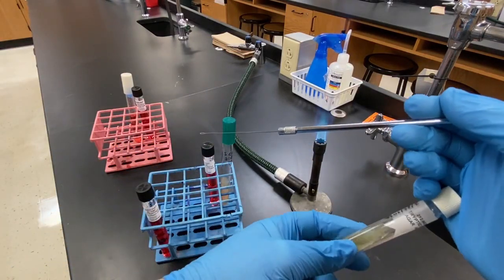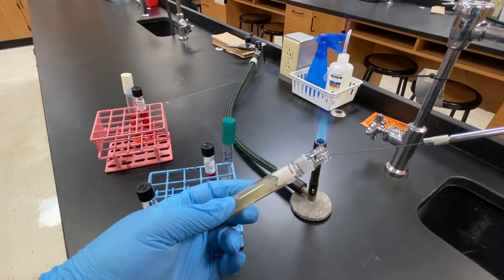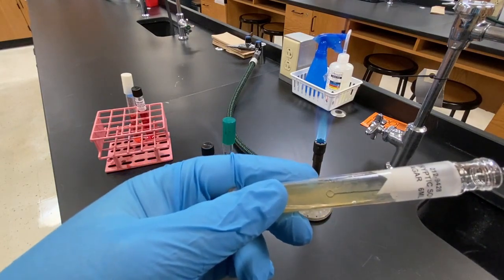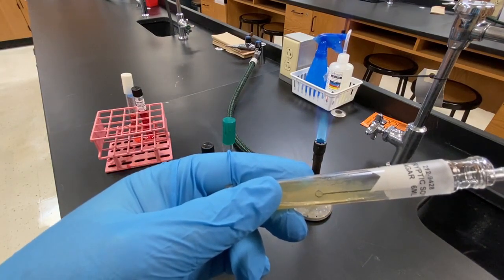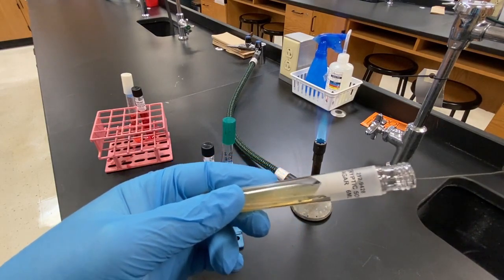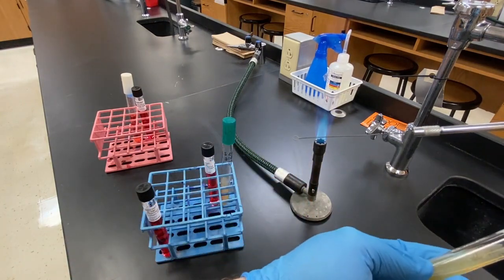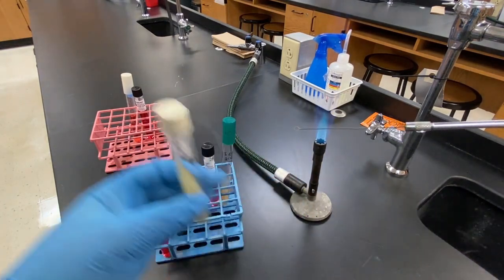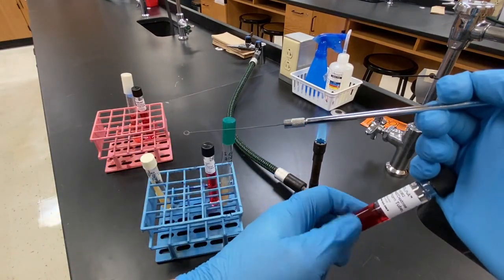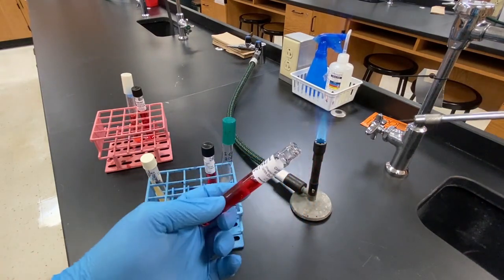When we go to pick up microbes from the culture tubes, we want a visible amount on the loop. And when handling the broth tubes, it is extremely important that you hold the tubes at an angle or the broth will pour out.